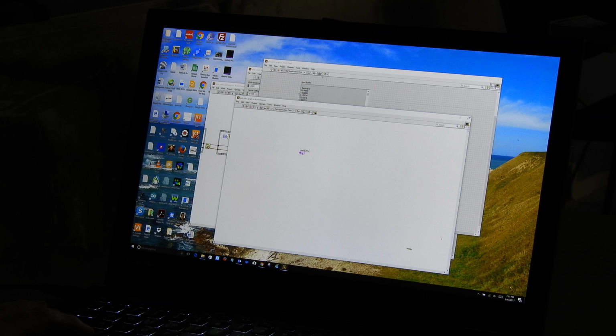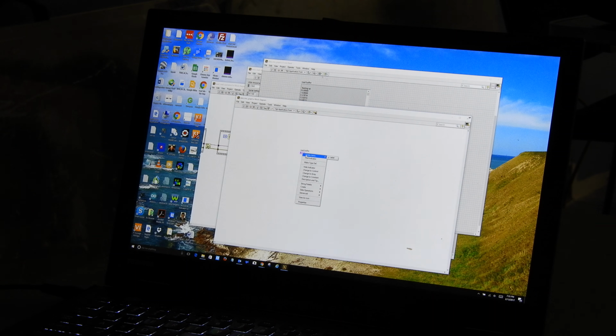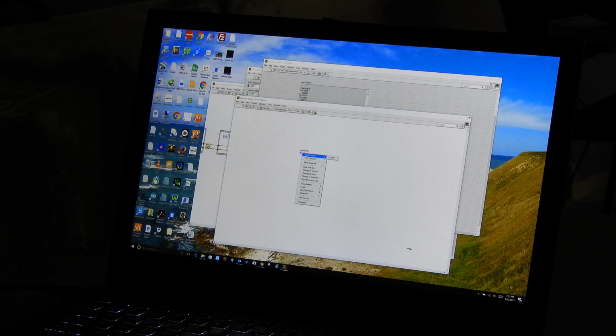Actually, right now it is an indicator, not a control. And you need to understand the difference between indicators and controls. An indicator is something that displays data. A control is something that we read data out of. Well, it's an indicator right now. So I'm going to change it by going over here and right-clicking on it. I'm going to change it to a control. Boom. Immediately, it changed to control.